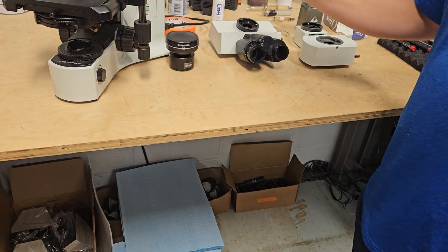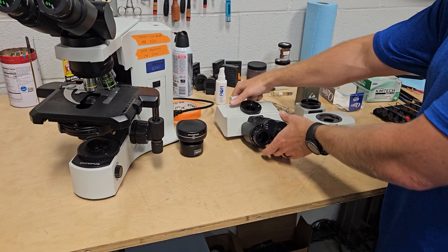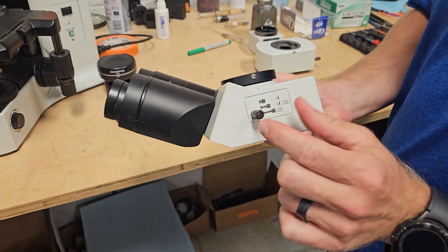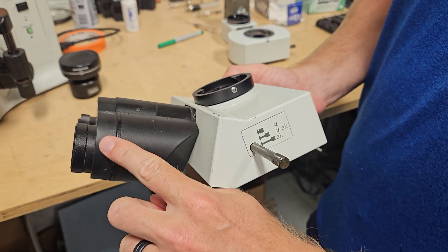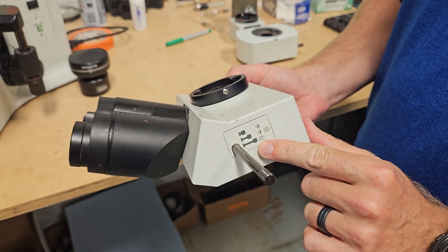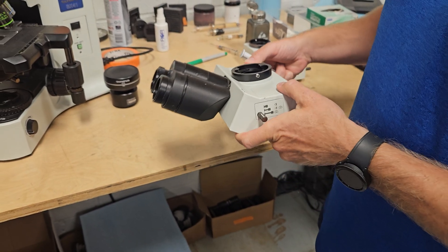You can change this tilting head for a trinocular head. The trinocular head has three positions. All the way in sends all the light to the eyepieces. When it's split, part of the light goes to the eyepieces and part goes to the camera. And when it's out, 100% goes to the camera. There's a nice little click stop so it clicks into place where it's supposed to be.